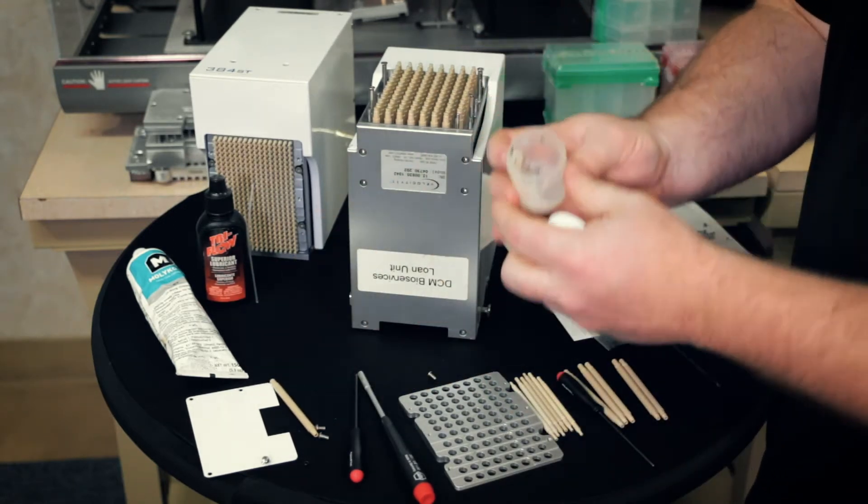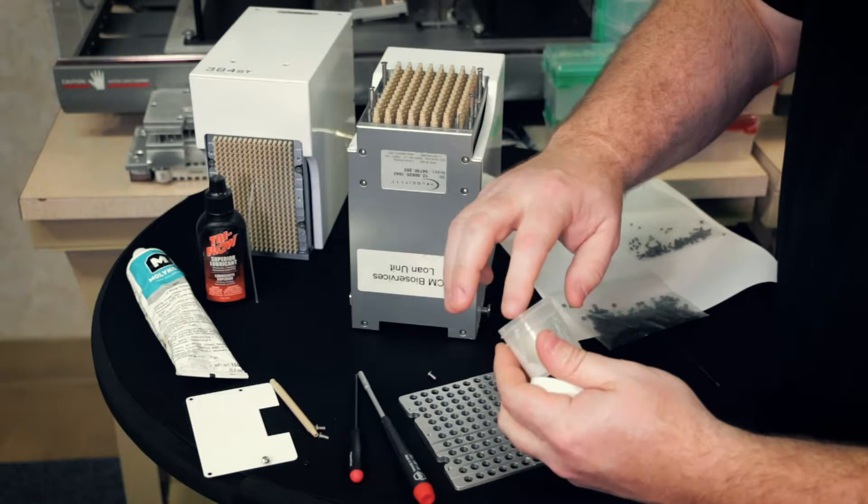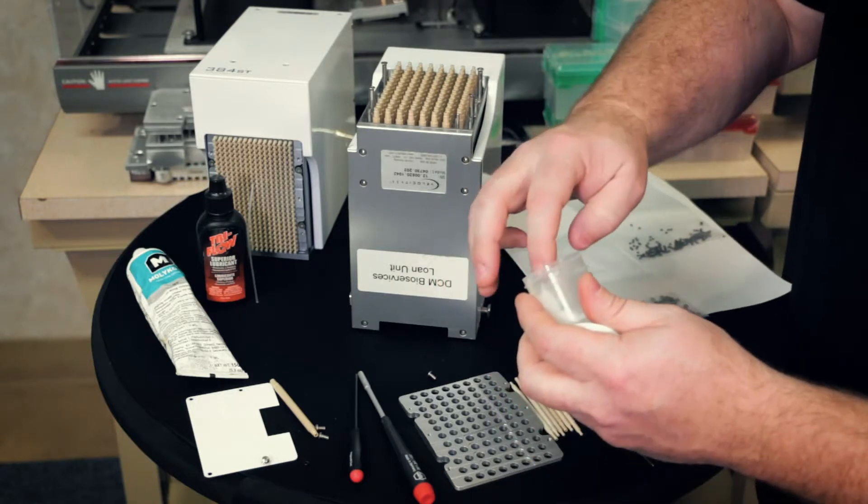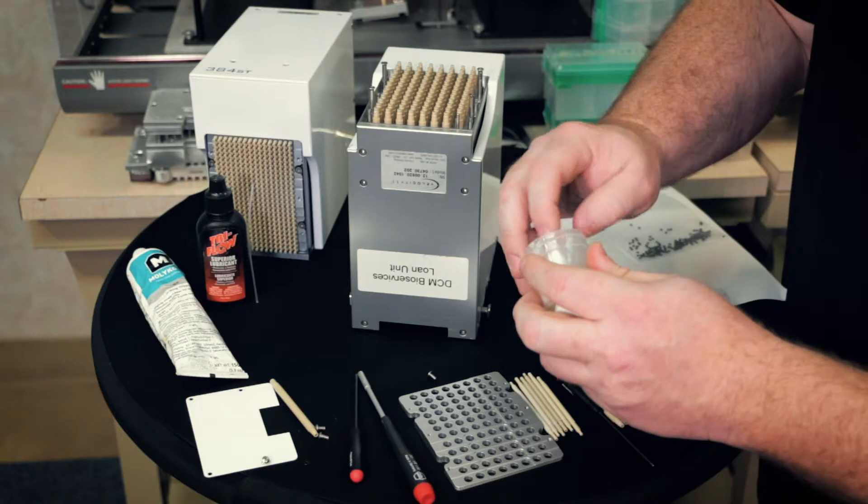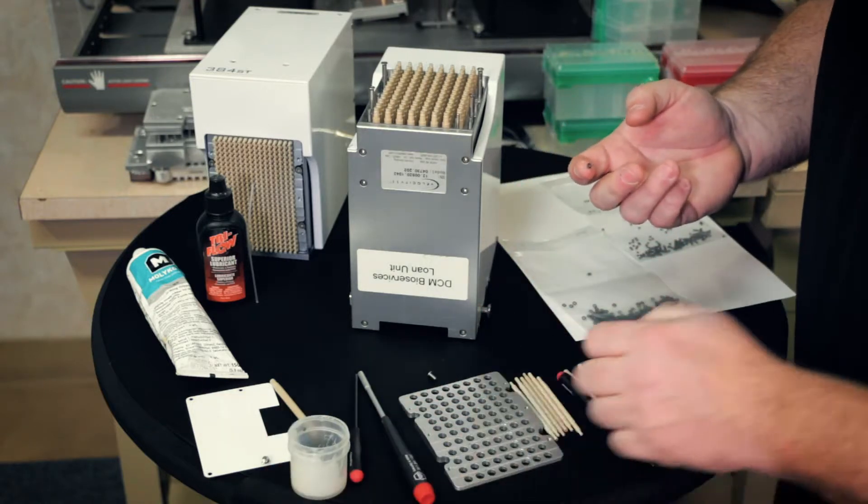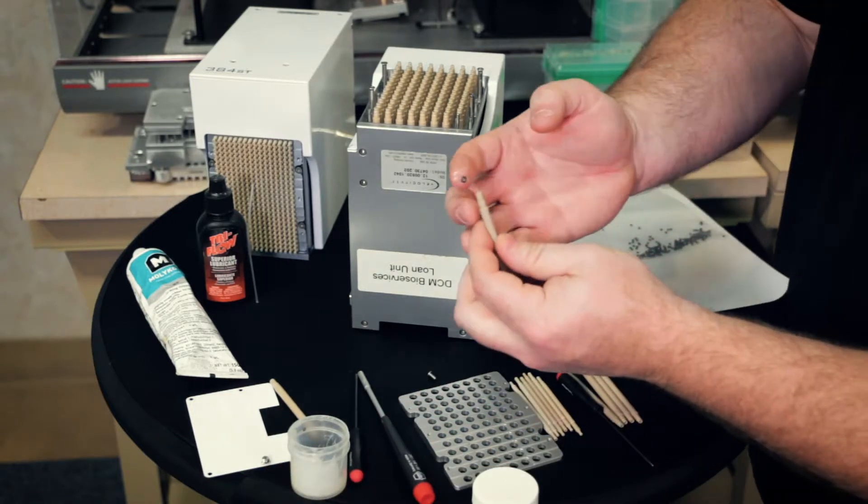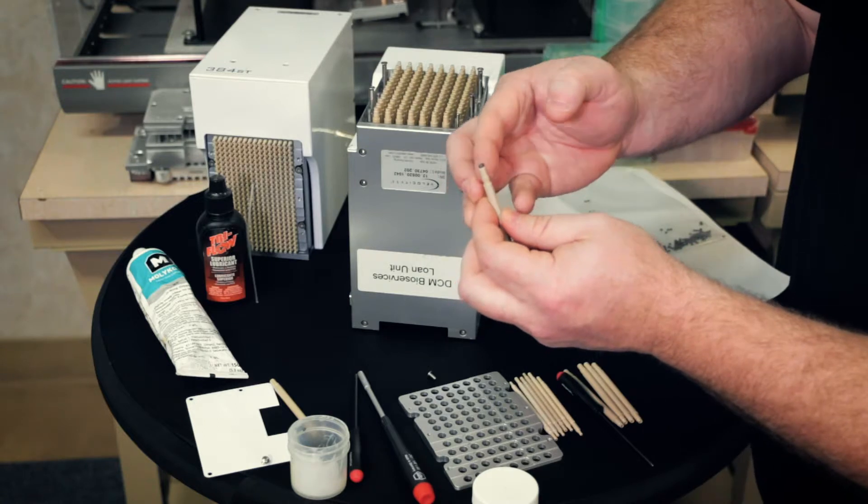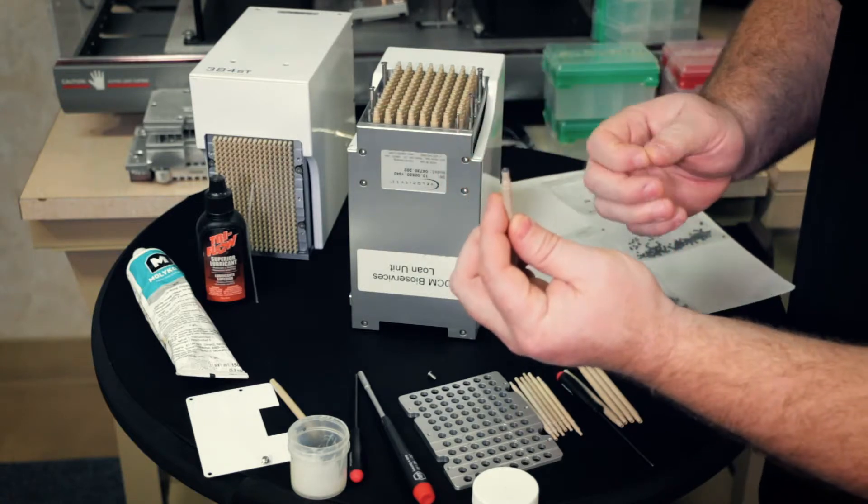And we would go get a new O-ring. Put it in your grease mixture. Just lightly coat it. A nice coating on each side of the O-ring. A little extra won't hurt. So we grab the new barrel, set the O-ring on top. The grease should hold it there.